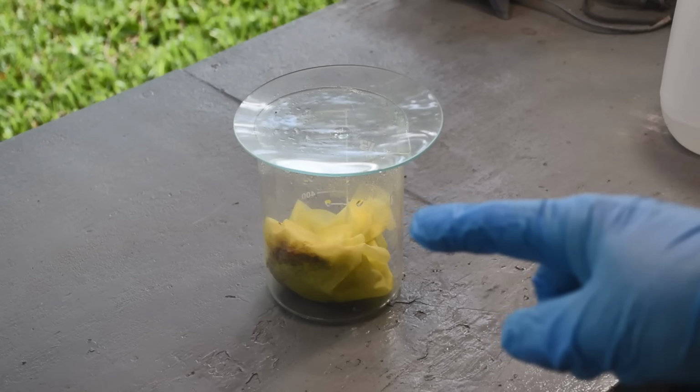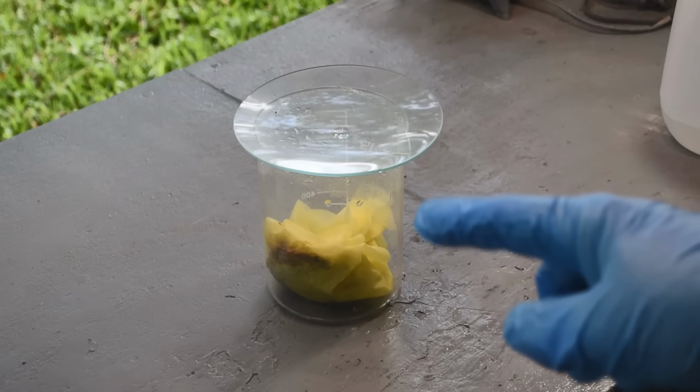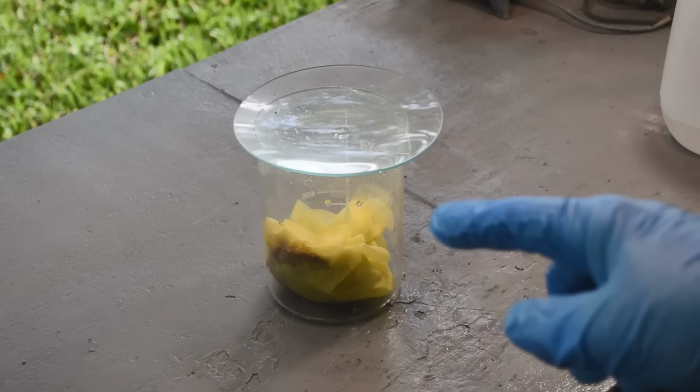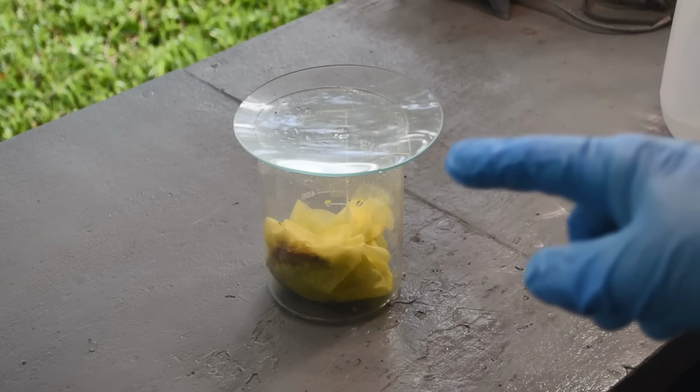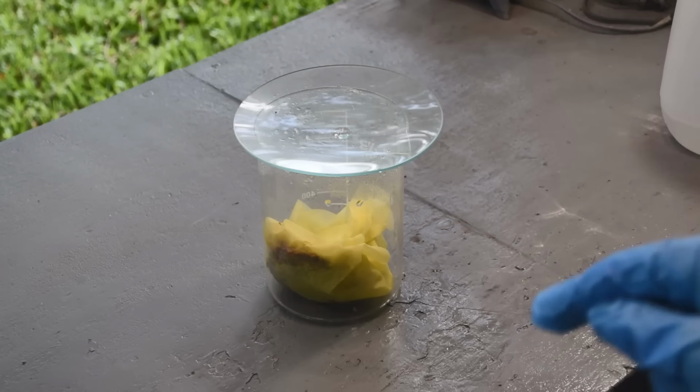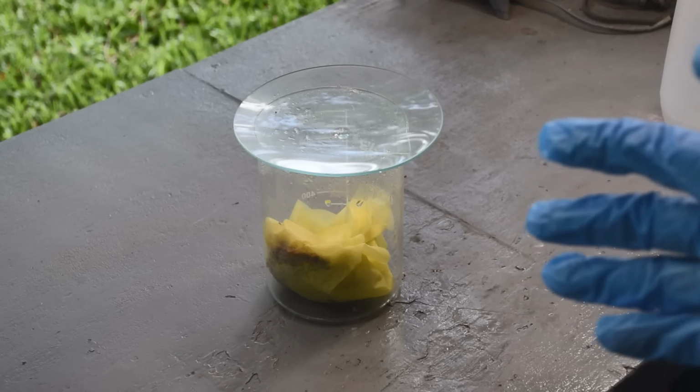There's filters in this beaker that have the red palladium ammonium chloride salt in them that I've isolated from Joven's strips. So it's time to turn this stuff back into palladium metal. So how can I do that? Well, there's several ways I can do it.